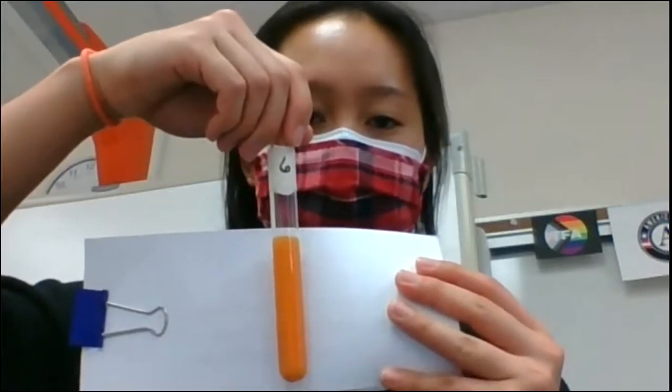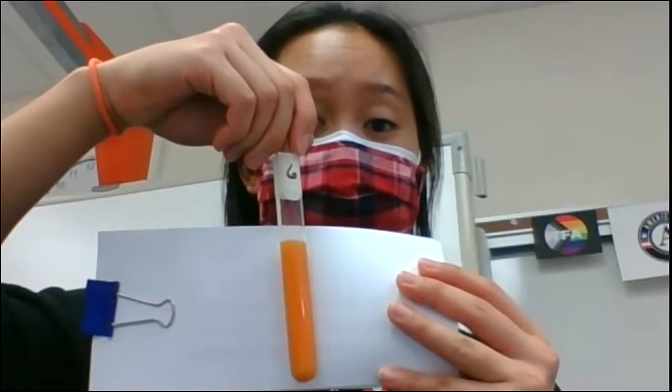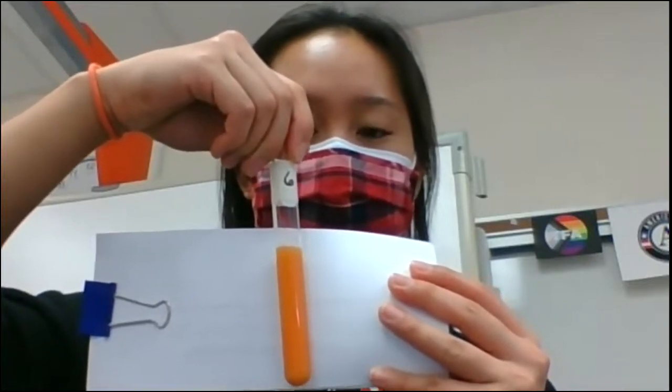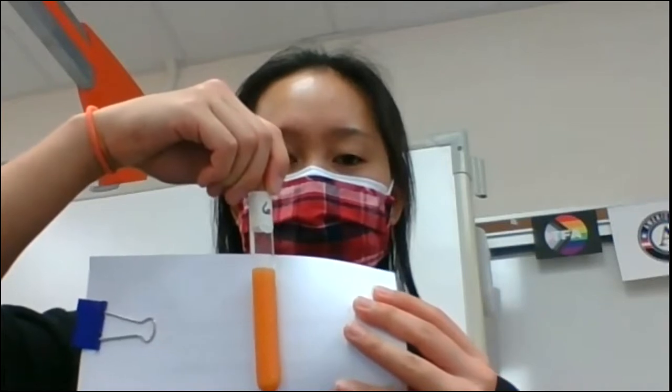The third one that we are going to do is test tube number 6, which is amylase plus starch. And that's our good old number 6 color result. Can you tell me what color it is? Again, remember it started out as blue. You want to tell me, based on the color change, what happened and what is the conclusion that you can explain about the reaction in this test tube. Okay, so this is part B on enzyme specificity.